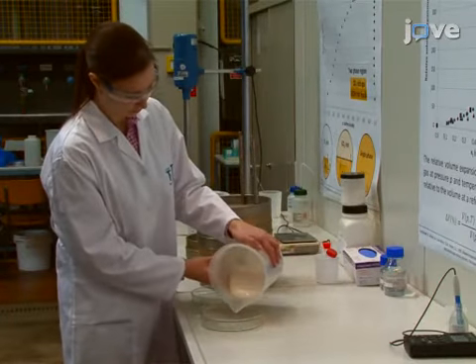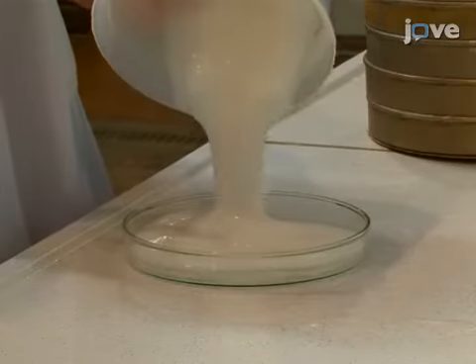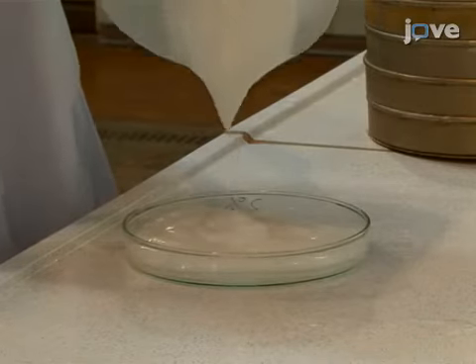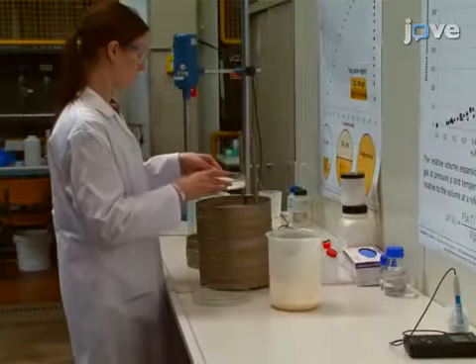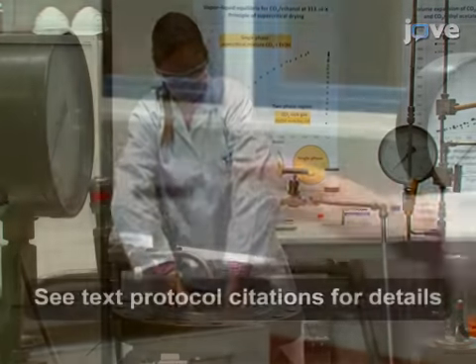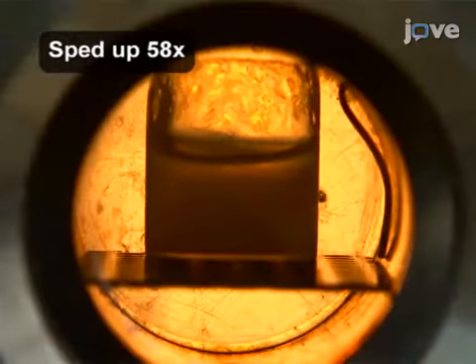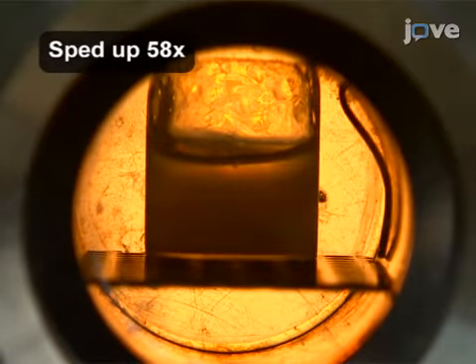Begin with transferring the prepared suspension into open polypropylene molds or glass petri dishes. Then, place the molds into a high-pressure autoclave. Pressurize the autoclave with carbon dioxide up to 5 megapascals at room temperature. The depth of the solution in the mold determines the gelation time. A thin 2 mm gel can be made in less than 30 minutes.